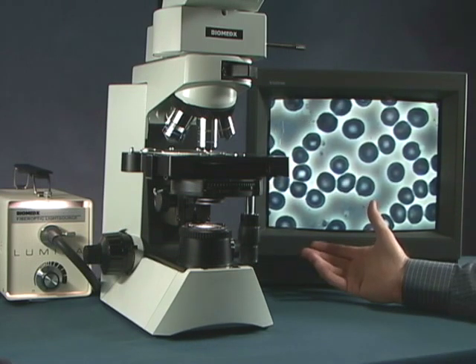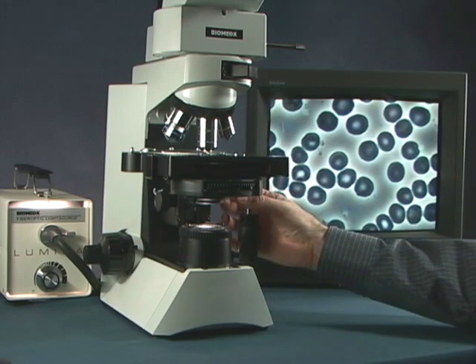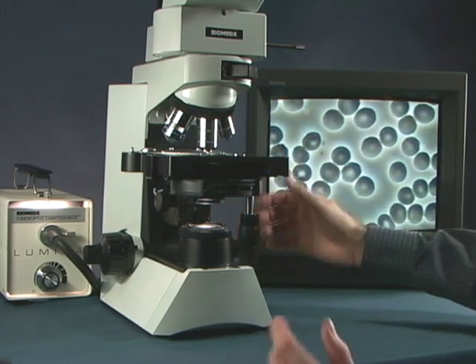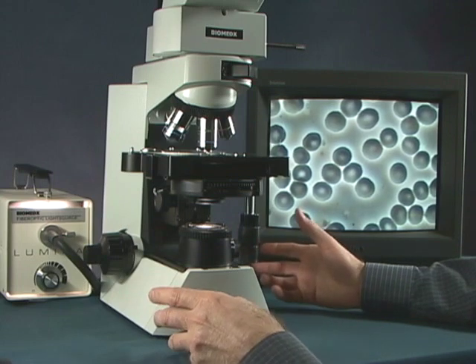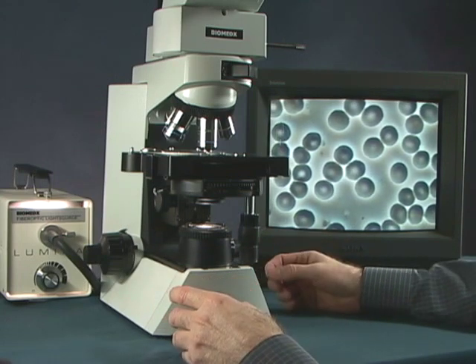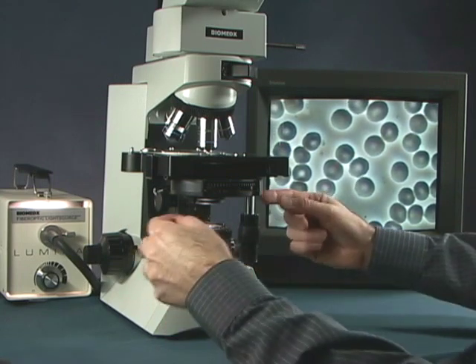So this is the image that you basically want. If you find that your image is off, maybe your microscope was at home and one of your children was playing with it and they pushed in the knobs.